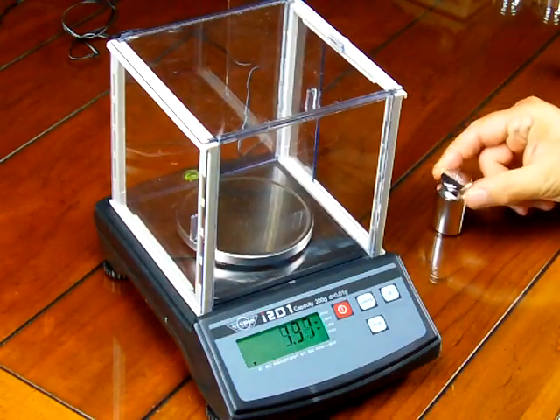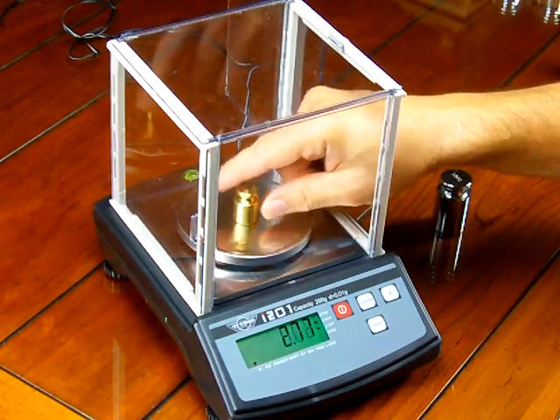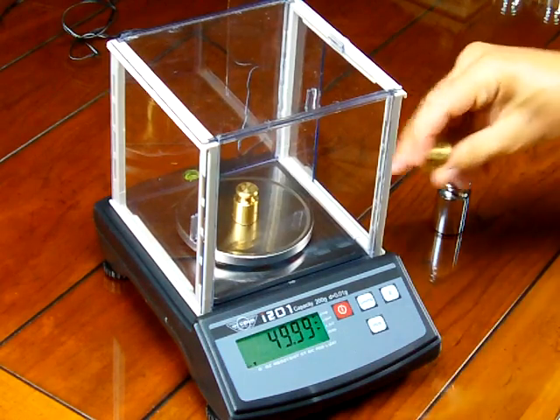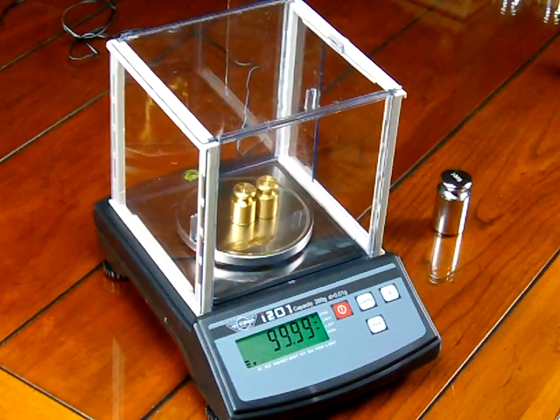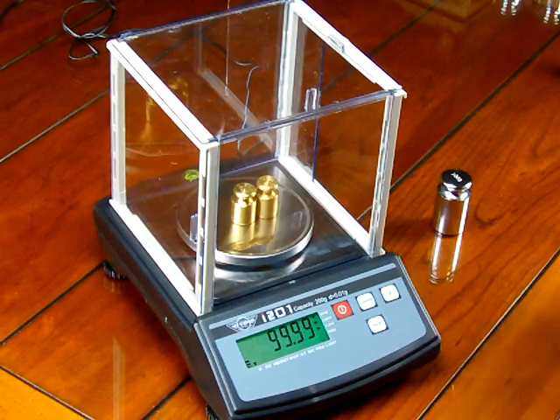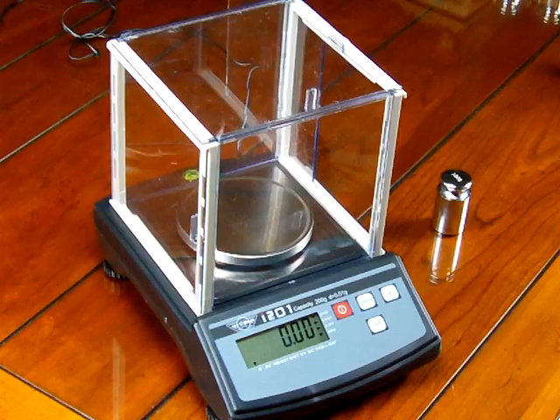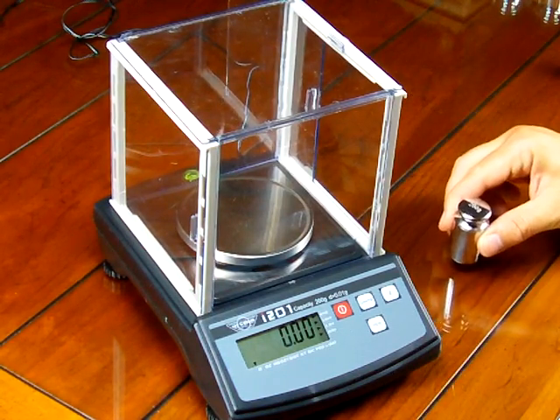If I put on my 50 gram weights that previously read 50.03, you'll see now they read 49.99. Throw on another 50 gram weight and we're at 99.99 — so the scale's been calibrated. We could let the scale warm up a bit longer and perform another calibration; we'd probably get it right on 100, and with the calibration mass, it would read 200.